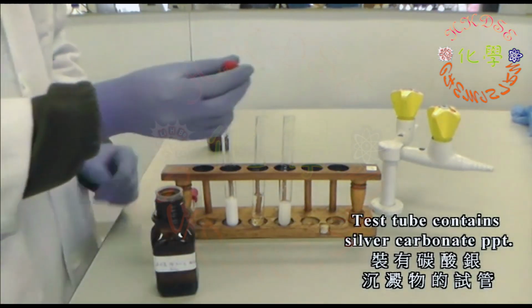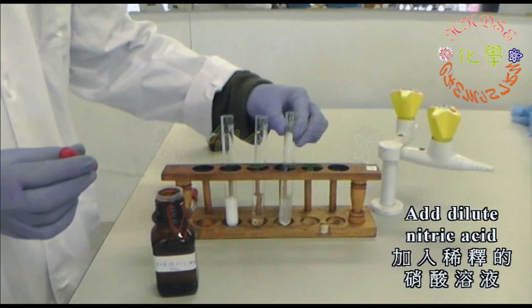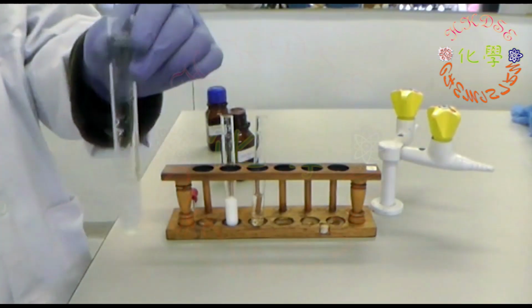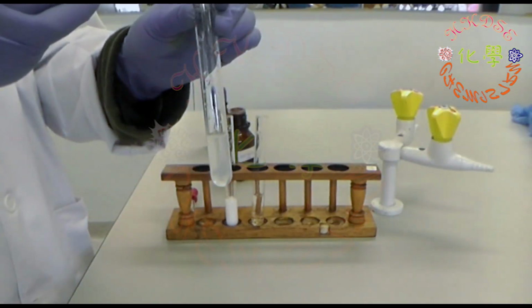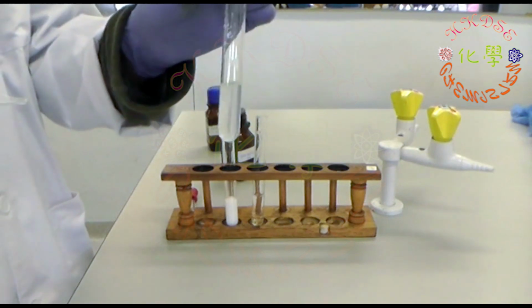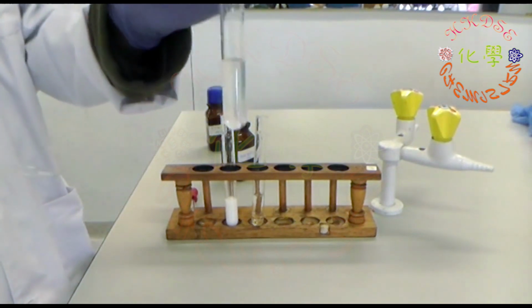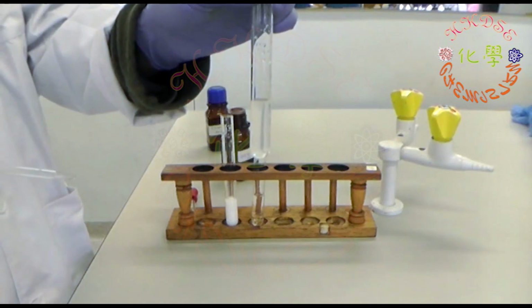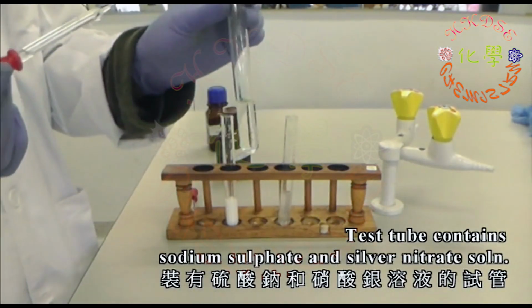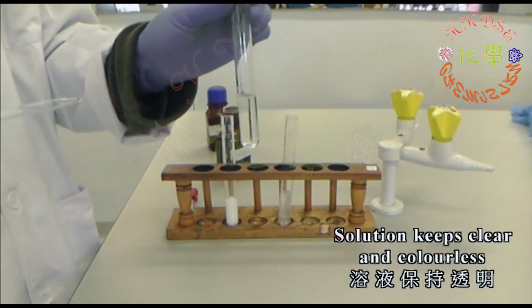The test tube containing the silver carbonate precipitate is added with dilute nitric acid solution. The test tube containing sodium sulfate and silver nitrate is added with dilute nitric acid solution and remains clear and colorless.